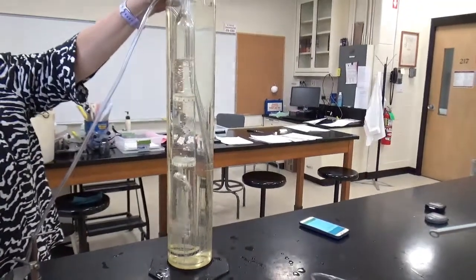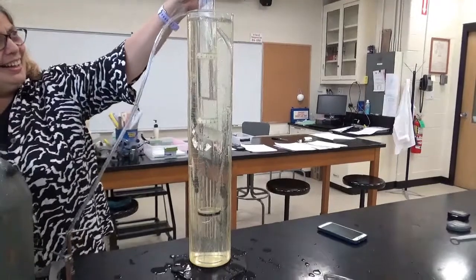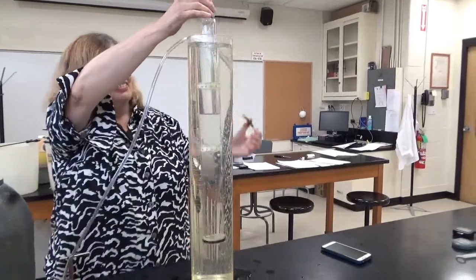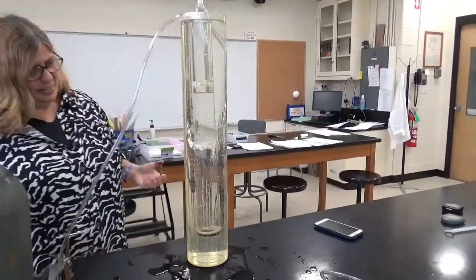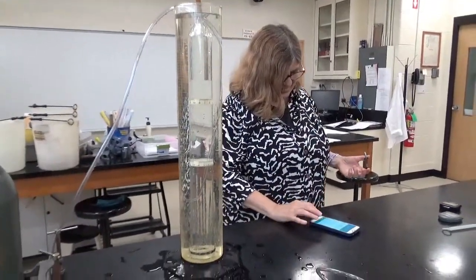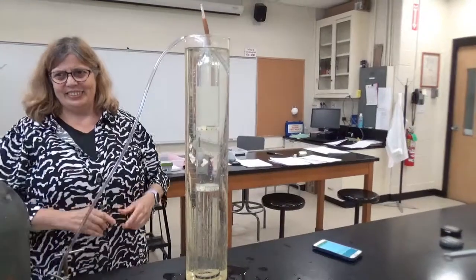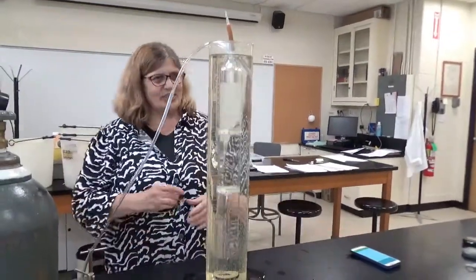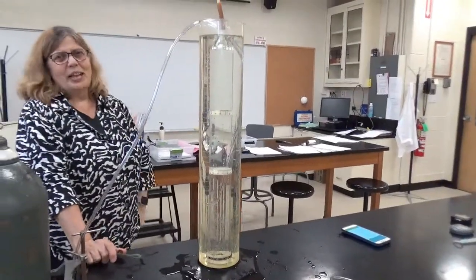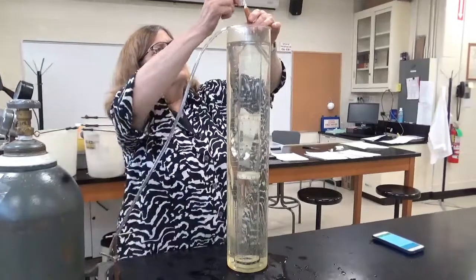There we go. So we're filling our tubing with carbon dioxide. Oh my gosh. Looks like there's a little too much water in this. I put a lot in, so I'm flushing this. Okay. Small flush. It's always a little messy, the CO2, because it comes out very fast. It's very hard to control. But, wow. What's a lab for but to get to have a little messy fun sometimes. It's only water.